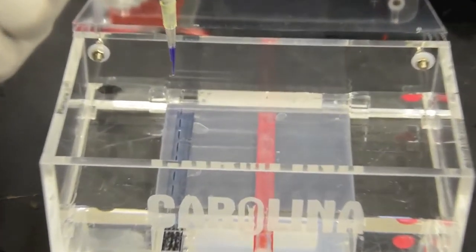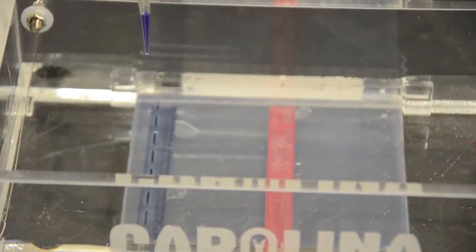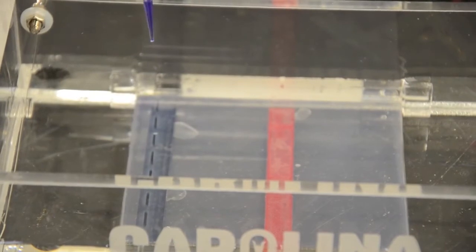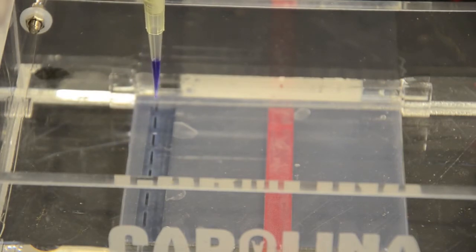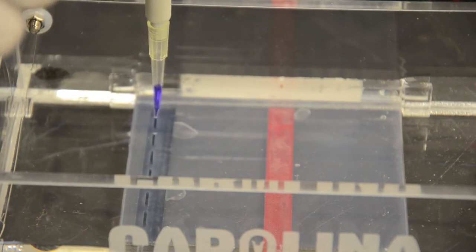Okay now that I have my wrist firmly grasped it is time to load our wells. Be sure you select your correct well and be sure to remember it throughout the experiment because it can get confusing with plenty of wells. And I'm just going to slowly hold the tip of the pipette over the well, be very careful this is the most important part of the entire experiment.